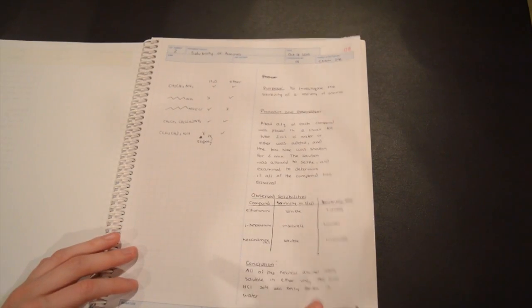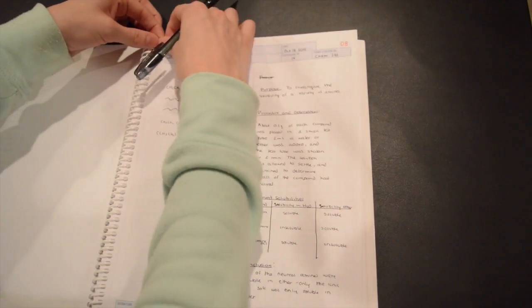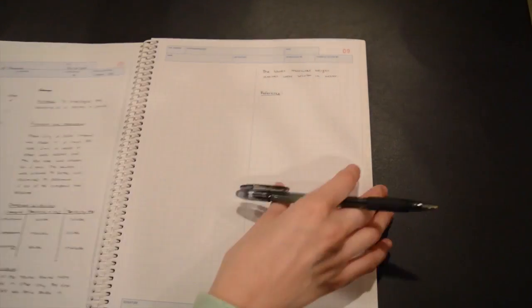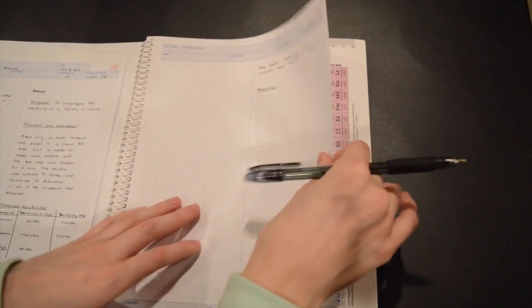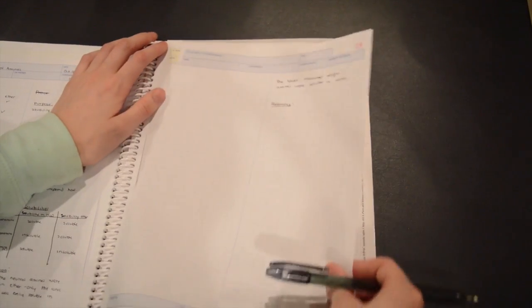You'll notice that the writing you did copied exactly onto the second page. Once you're done, you can rip out the first page of each page set and leave the yellow copy in. Leave the yellow copy in, and now this is ready to hand in to your lab TA.